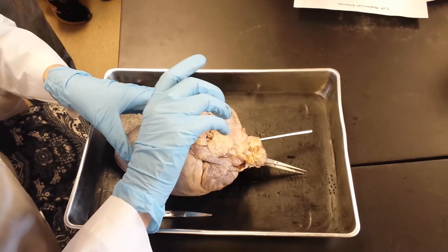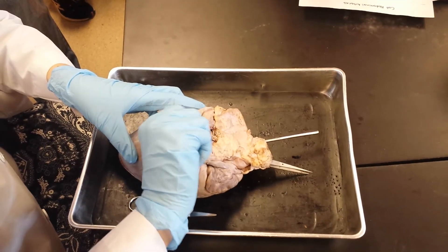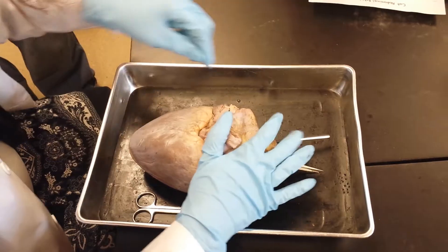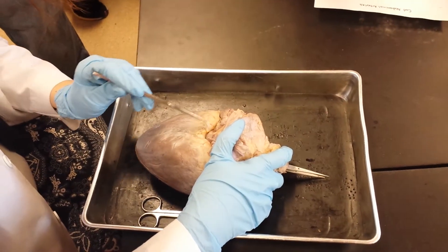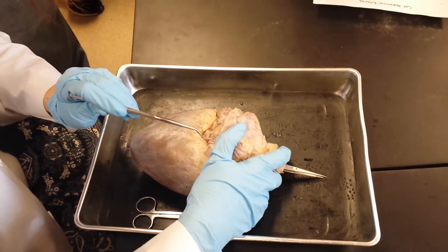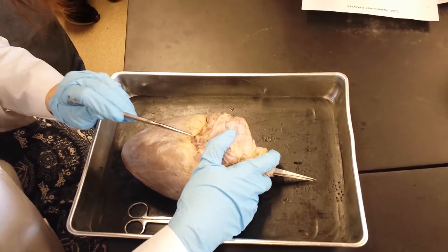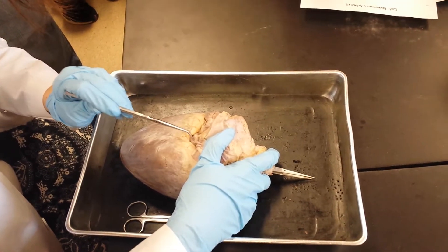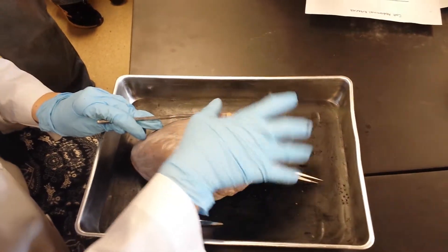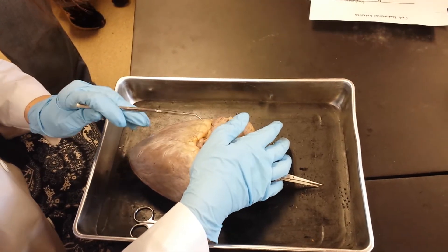Here I have basically folded up the inferior vena cava. When I fold these up, a lot of times you'll be able to see the coronary sinus running along in here — and I can see part of it right here. It's a thin-walled vein that often runs along somewhere in here. This is the coronary sinus on this one; you'll be able to see it. On the exam I'll have stuff flipped up and I'll have a pin in it. So that's your coronary sinus.